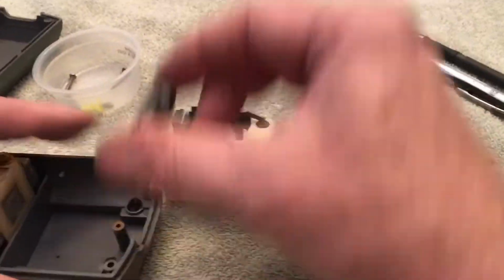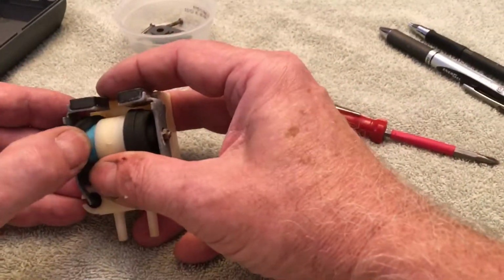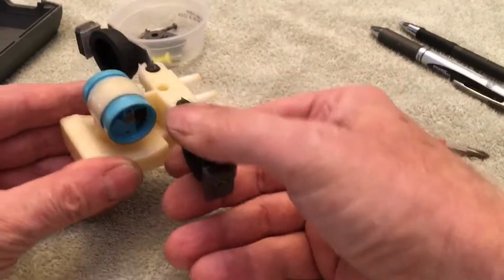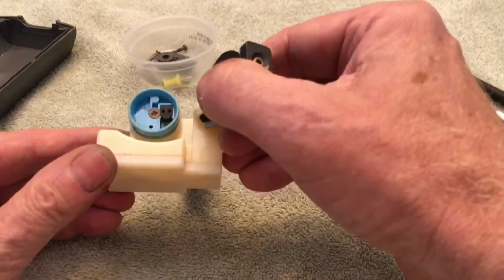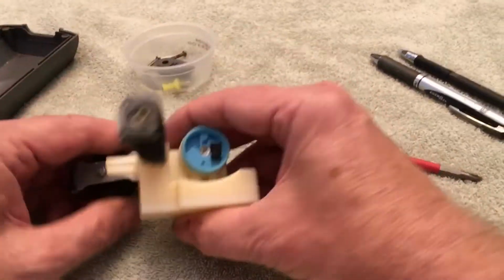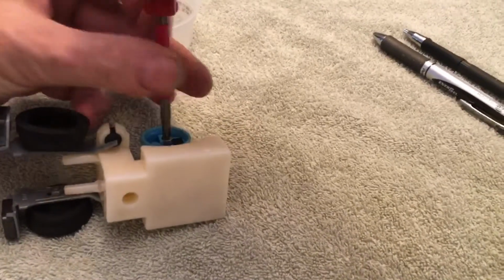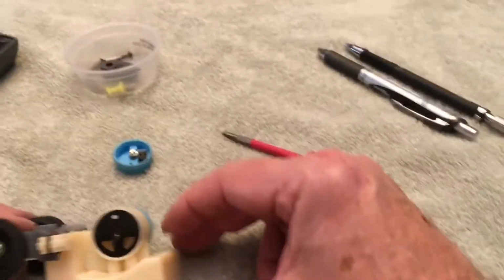This is the part that covers the tubes. And now you'll see there's rubber cups around the pump mechanism, which will twist off. Once again, if it's an old pump, you can disassemble it to clean it. And what we want to do is reverse these. So we're going to open a valve cap, and what we need to do is change the direction of flow.